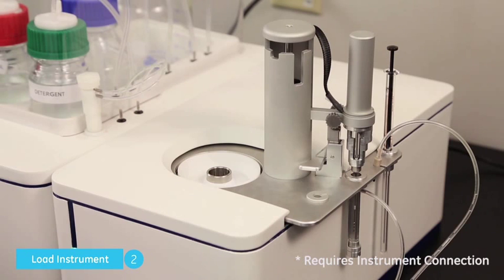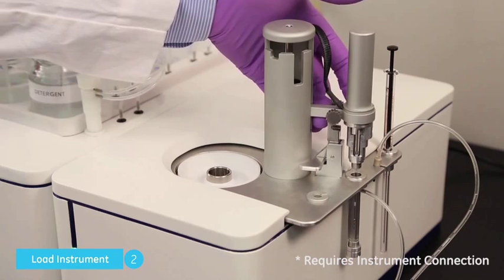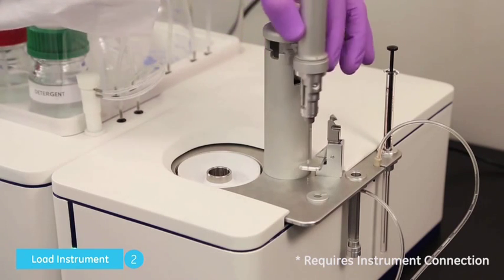If the pipette is in the clean location, you may need to press the clamp's release lever. Now move the pipette to the rest location.